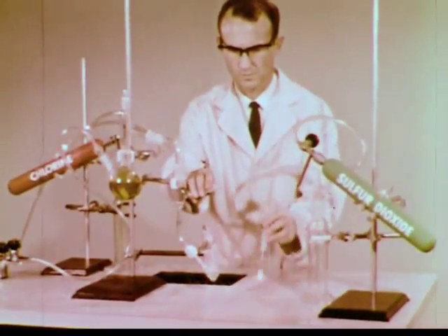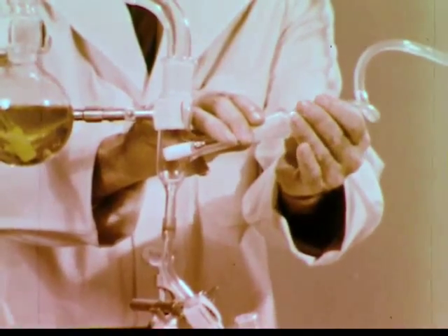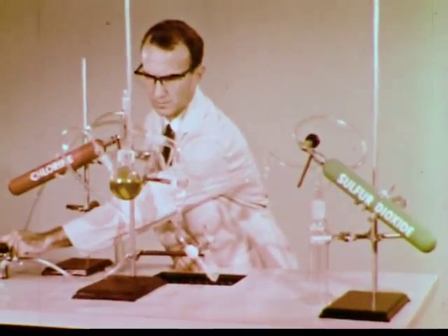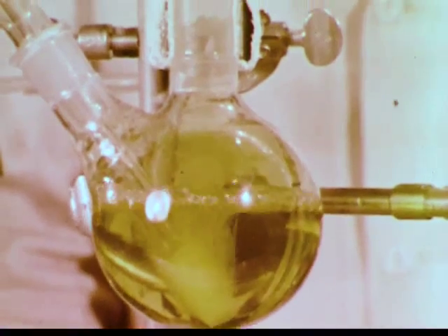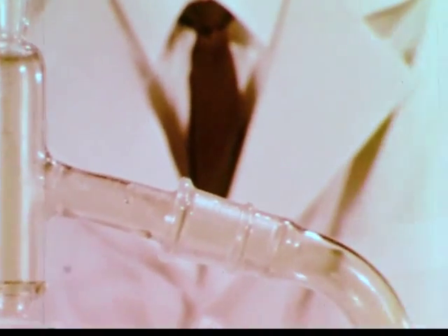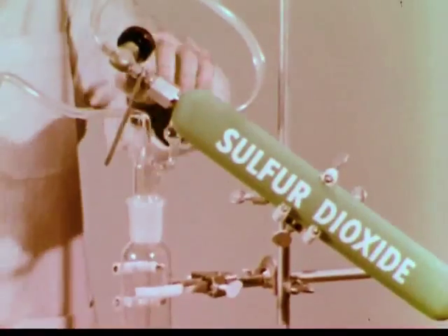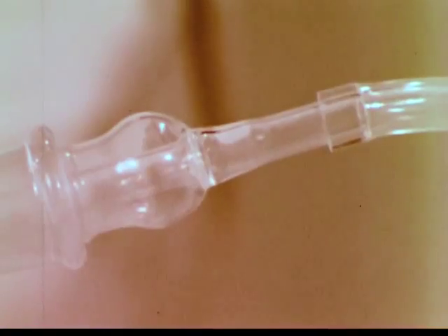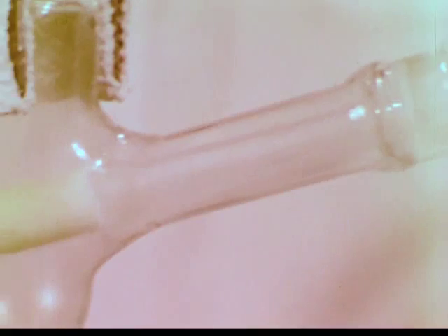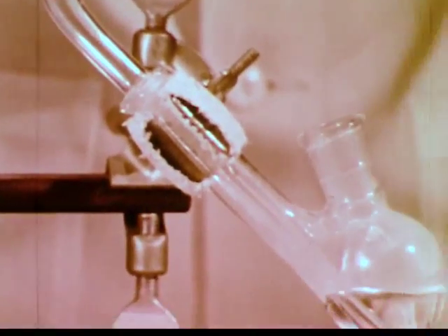We have modified the apparatus to attempt the reduction of bromine with sulfur dioxide. The compressed air is again turned on, and elemental bromine is blown out. The sulfur dioxide is added through this tube and mixes with the bromine and water vapor coming down the column. The bromine color disappears, and colorless hydrogen bromide gas is formed, which passes into the water in this receiver.